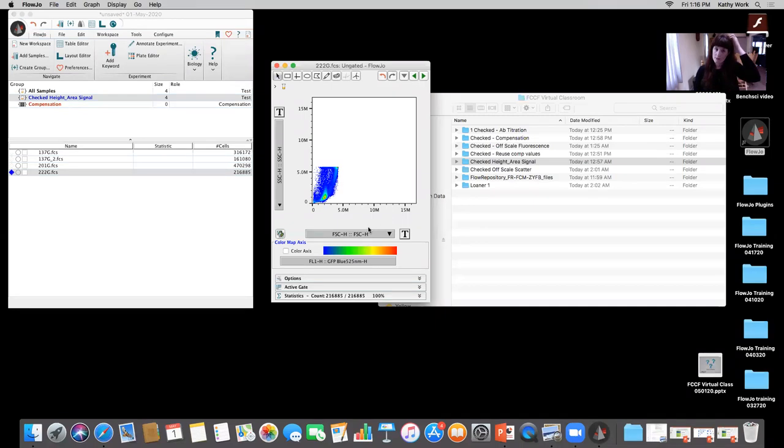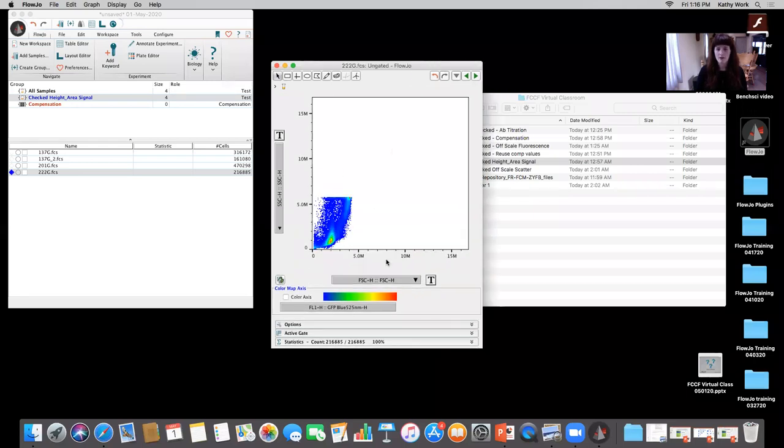Okay. Now typically when we're first starting to look at our data, what we expect to see is potentially the whole range, right? So if it's saying that the detector range is 16,777,216, why is it that when I'm looking at this data, everything is kind of within this 5 million range? The reason for that is something that has been known on this instrument: it's actually saturating at a certain point. So even though there's the range of 0 to 16 million, roughly, we're seeing it's kind of saturating at this point.